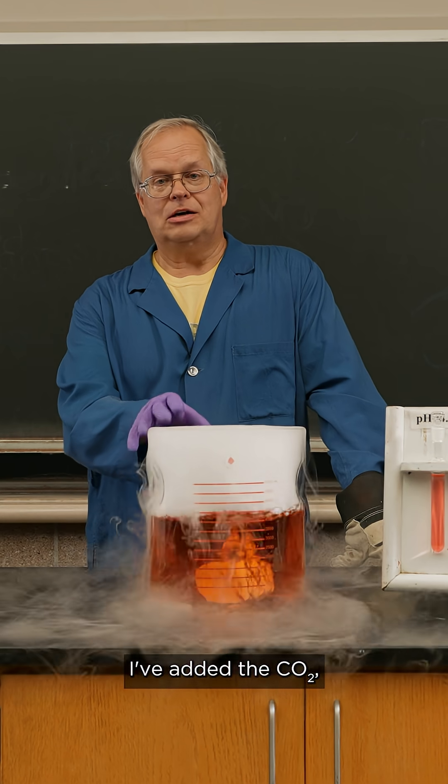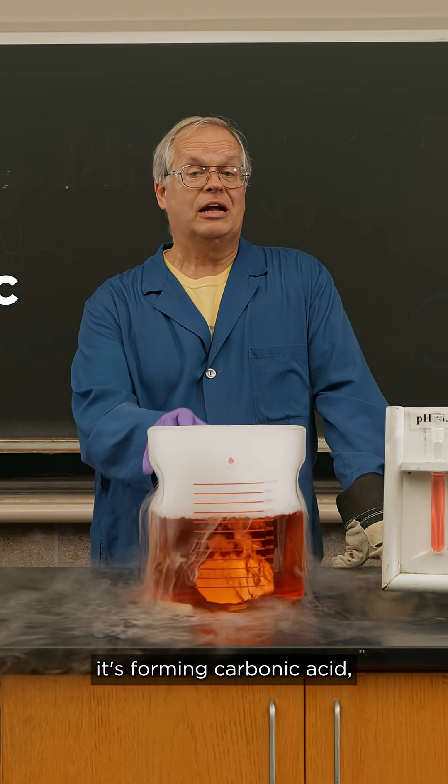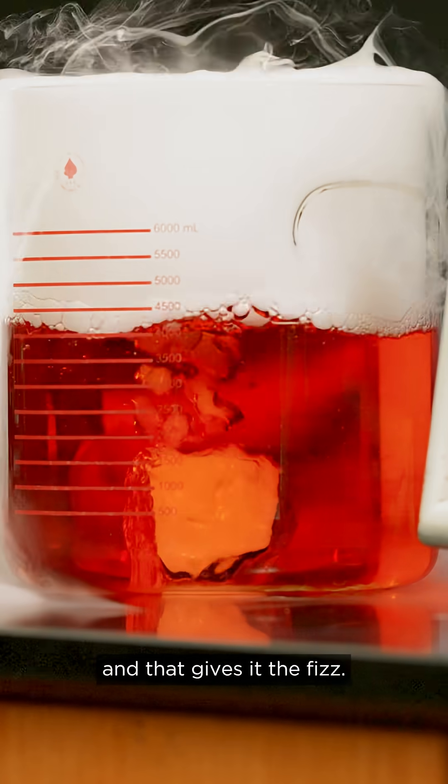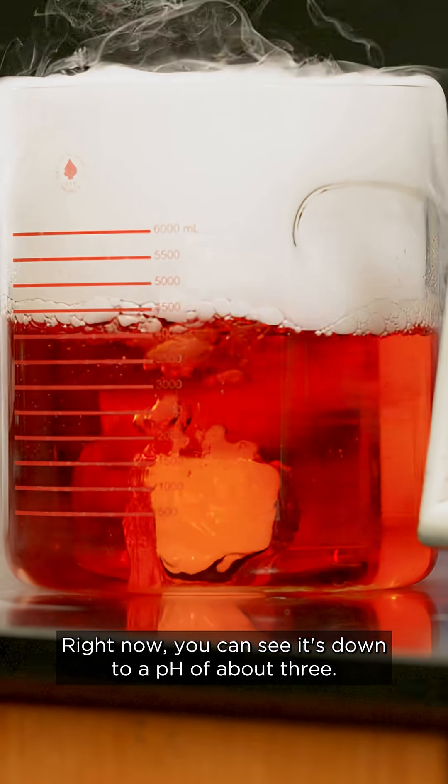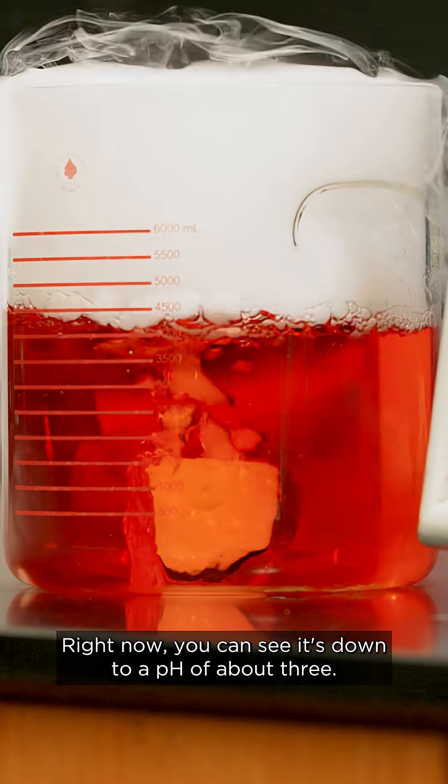I've added the CO2, it's forming carbonic acid, and that gives it the fizz. Right now you can see it's down to a pH of about 3.